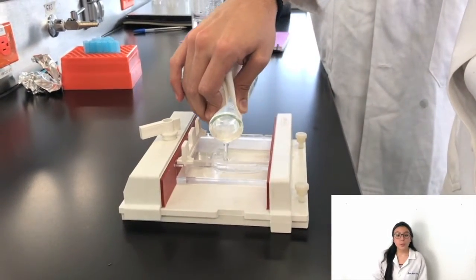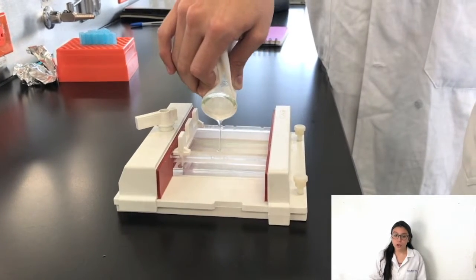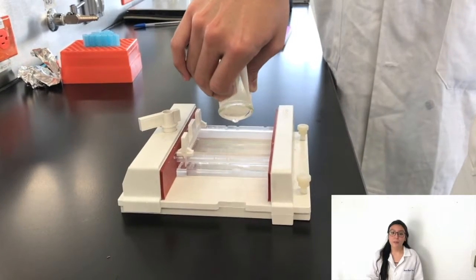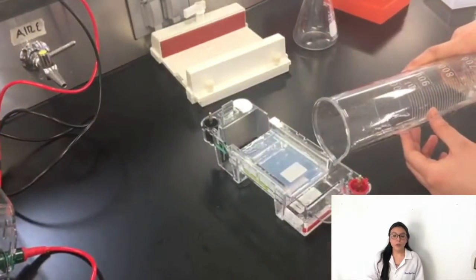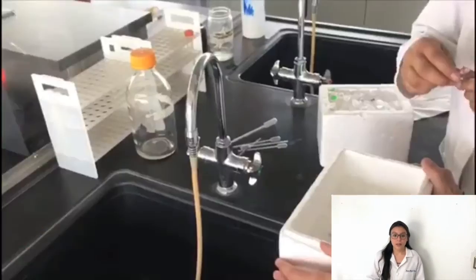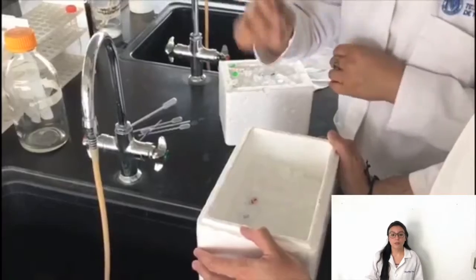Important! For the 2.5% agarose gel, it is not necessary to let it cool. So, take it out of the oven, apply the gel red, and perform the steps as described above. Remove the comb. Cover the gel with the running buffer TBE 1X or TAE 1X, registering the order of how the samples are loaded into the gel.